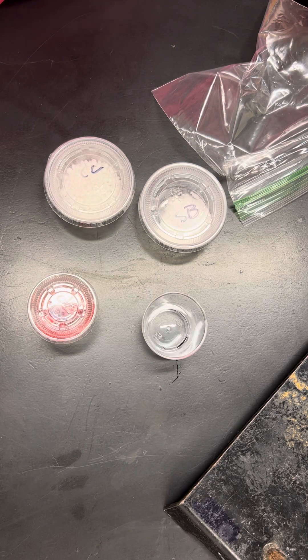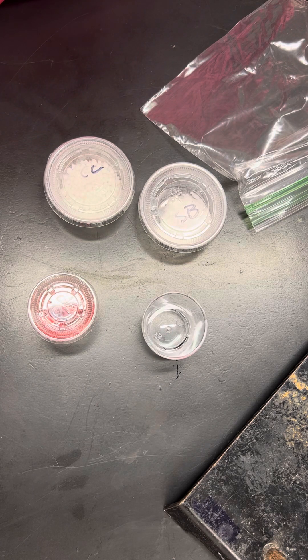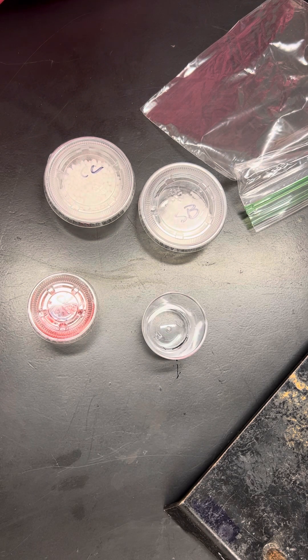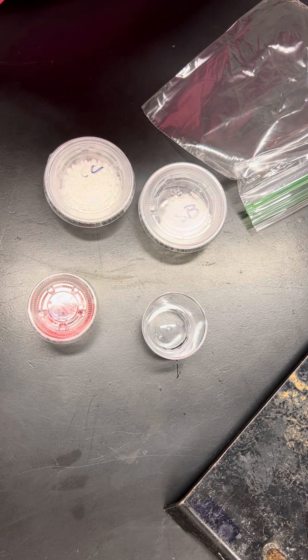All right, for this experiment we are going to be combining four different substances to see how the properties may change.